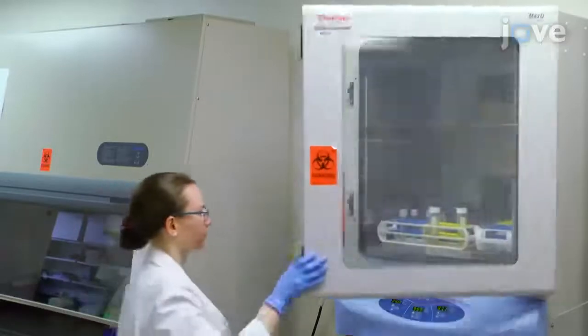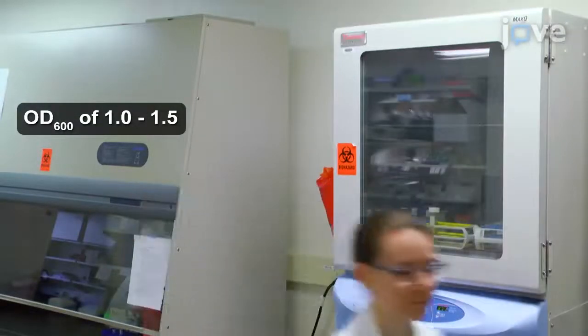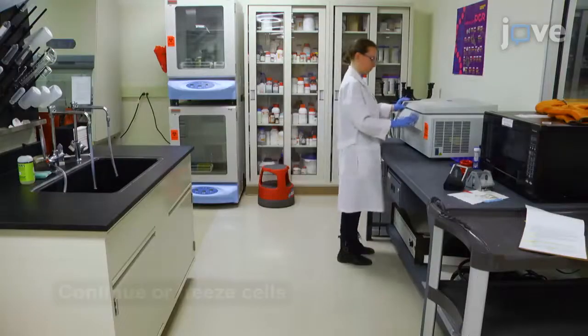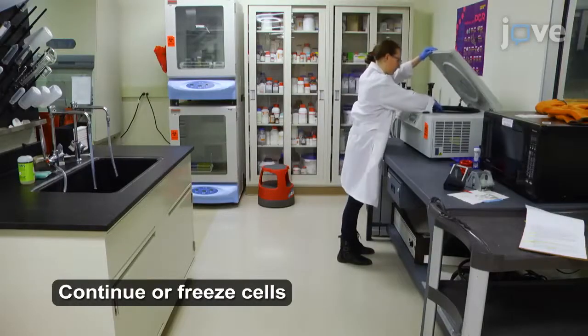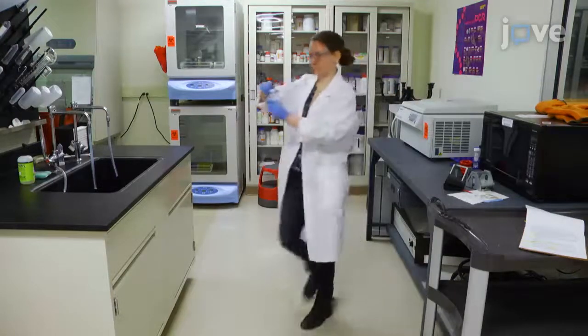Grow bacteria in 15 milliliters of tryptic soy broth or similar rich media to late exponential phase. Harvest the cells by centrifugation before washing once with tris-buffered saline EDTA, or TBSE.